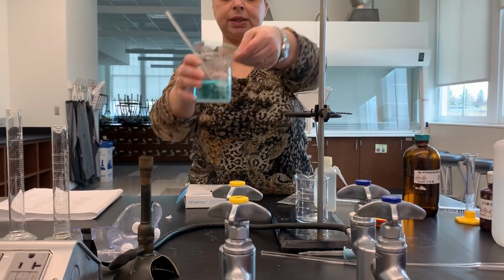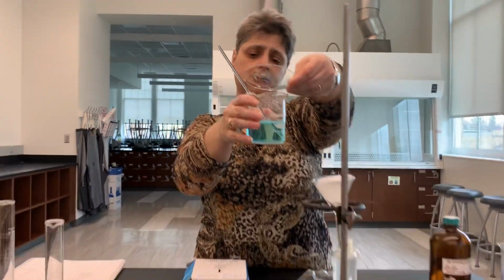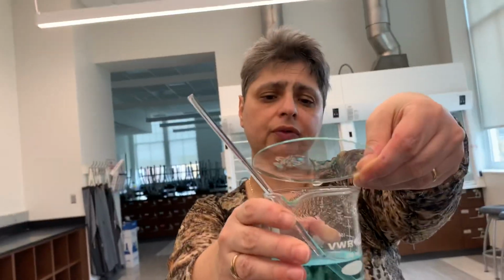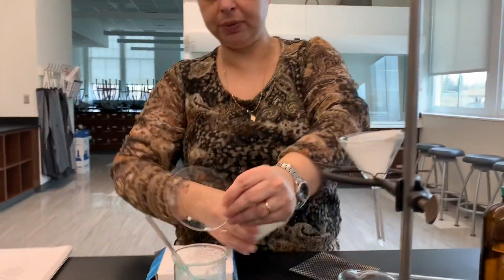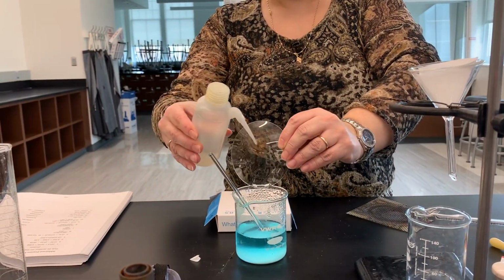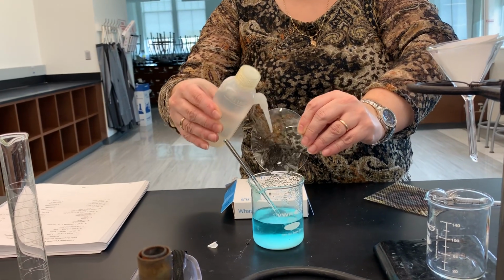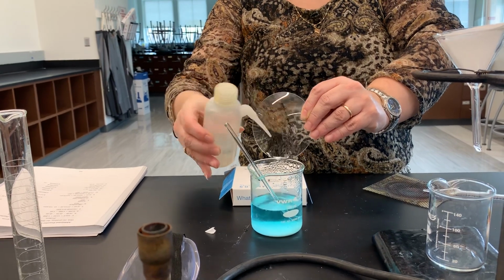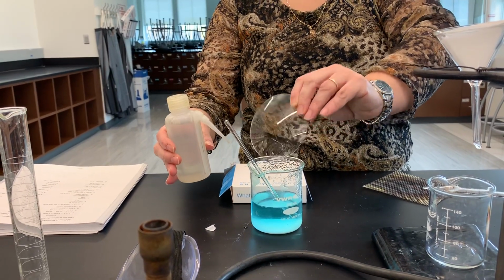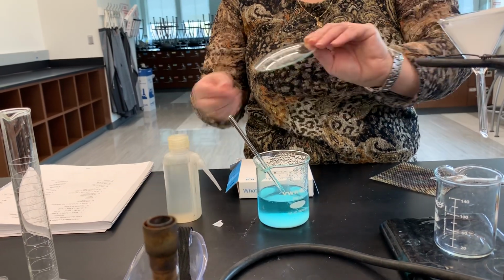As you can maybe see, there's some moisture accumulated on the beaker. Because the beaker was hot, I covered it with a watch glass. So I'm going to hold the watch glass above the beaker, and I'm going to use my wash bottle to wash down this liquid, because that liquid might contain some of the barium sulfate. So I don't want to lose literally any of the barium sulfate. So I washed it down.